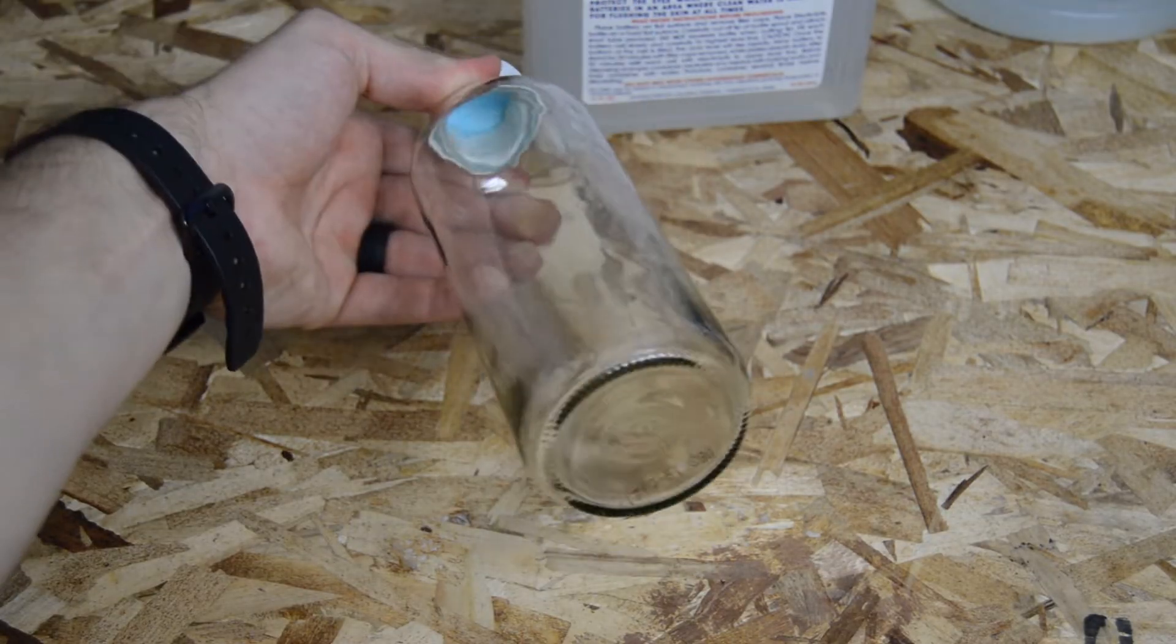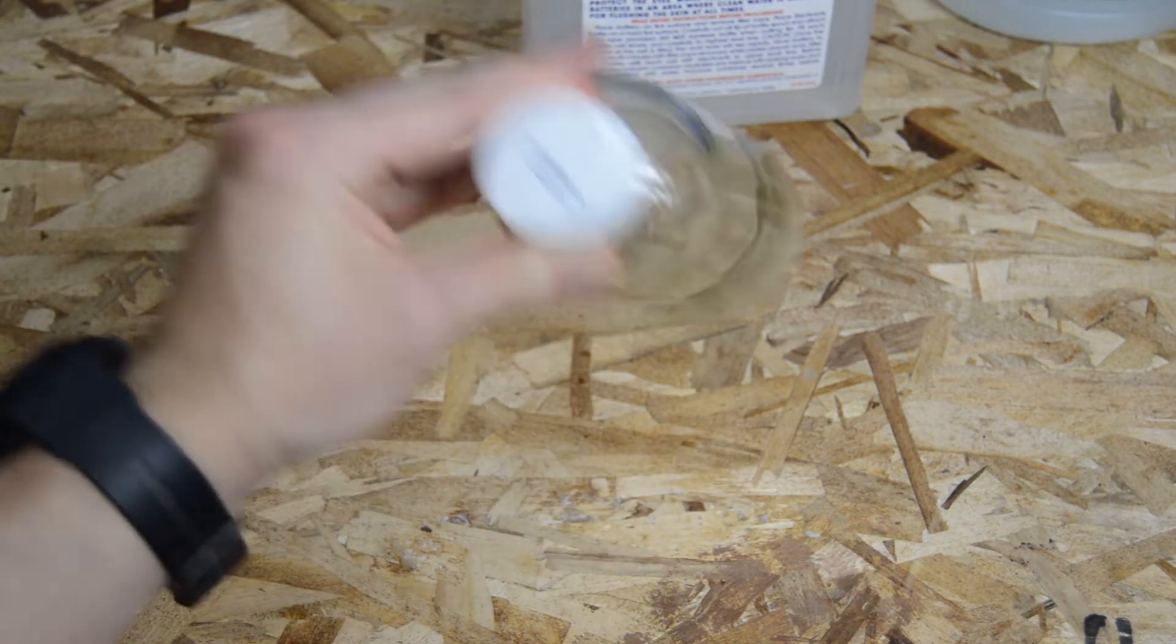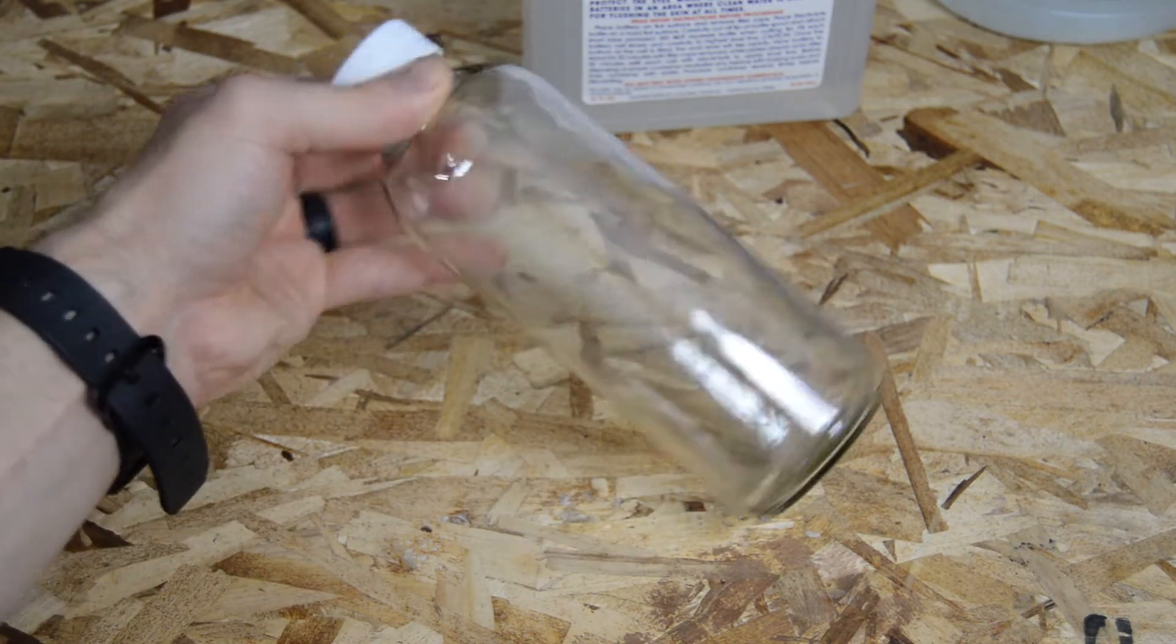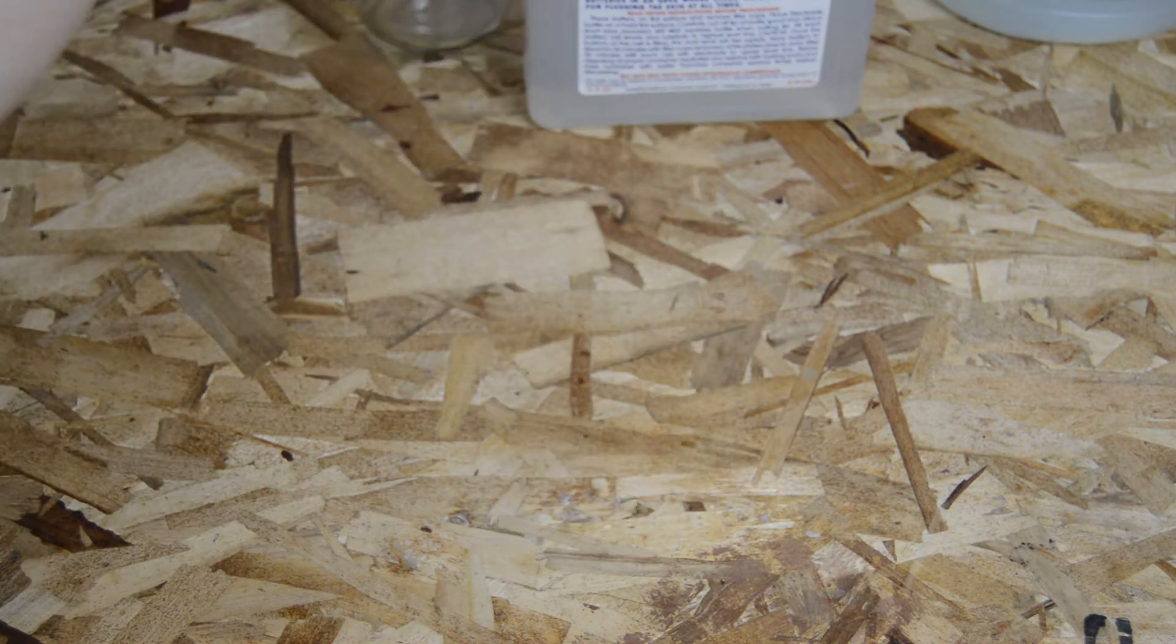You'll also need a glass jar or beaker to mix everything in. The solution will get fairly hot during the reaction and you don't want to take the chance that a plastic container could possibly melt.